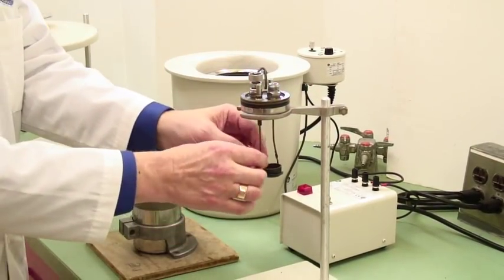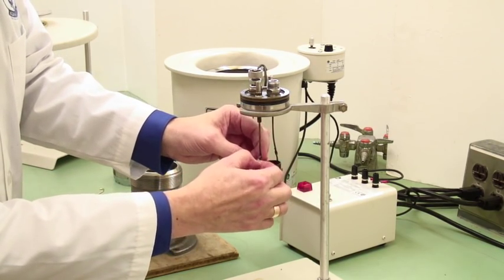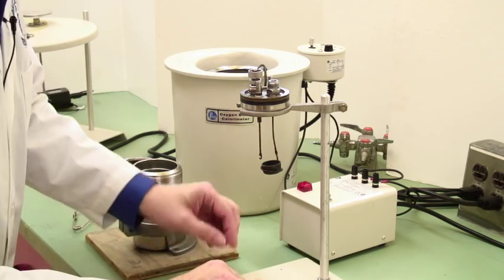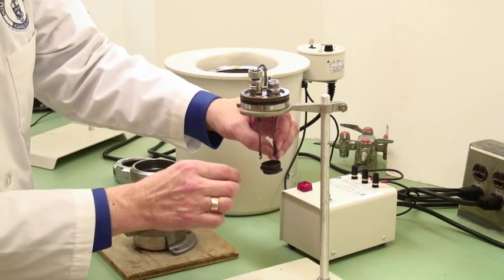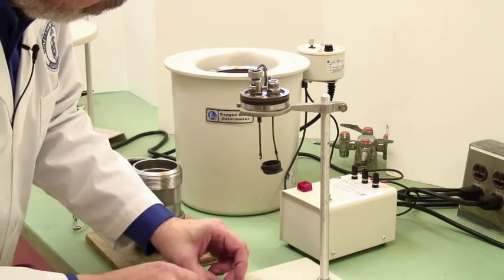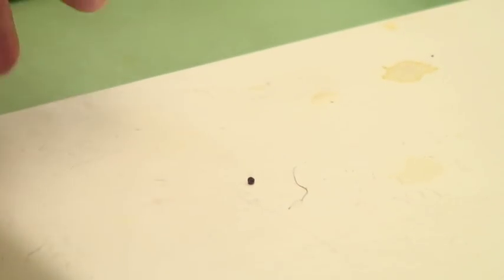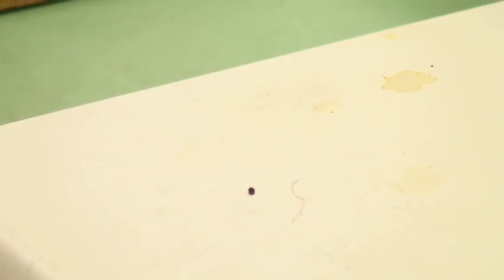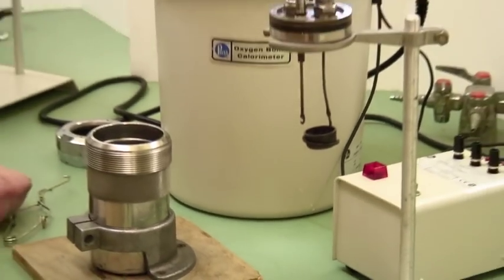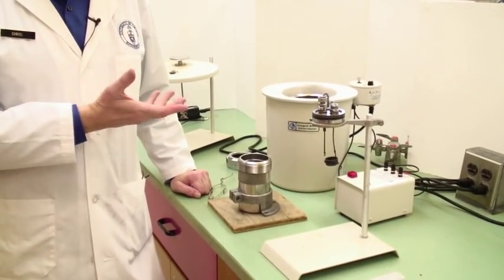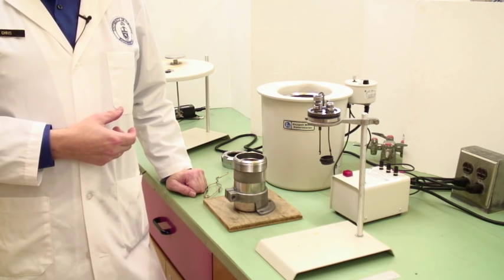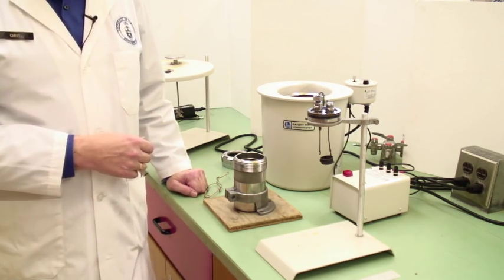The other thing that you need to do is to remove the remains of the fuse wire. There's one. And here's the other, very little on that side. That is a lump of fuse oxide. And in fact there's no wire left on this side. Usually there's two. But straighten out the remaining fuse wire and measure it so that you know how much fuse actually burned by subtracting the leftovers from the initial. The actual heat of combustion of the fuse is given, and so you can then subtract that from the amount of energy that you calculate and realize that the rest of the energy came from the benzoic acid.